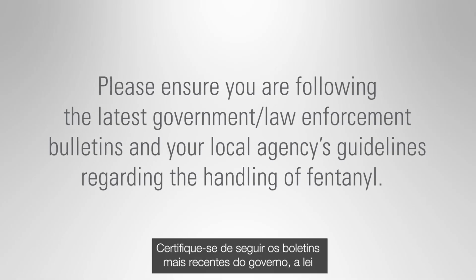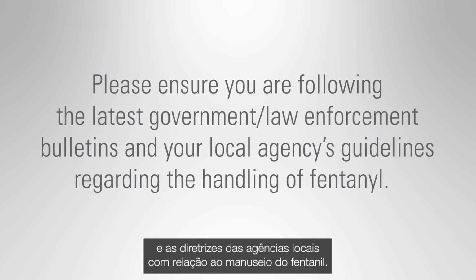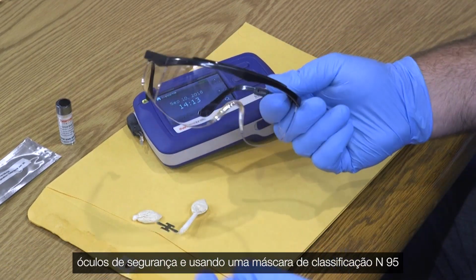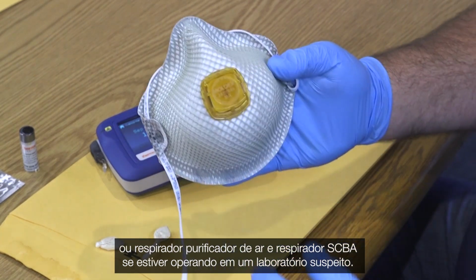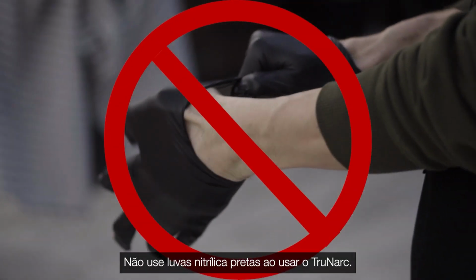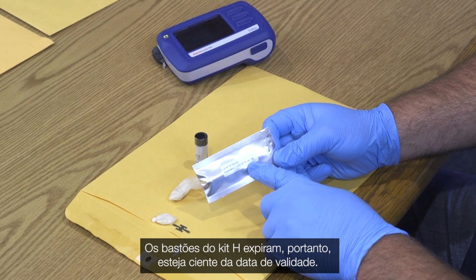Please ensure you are following the latest government and law enforcement bulletins and your local agency's guidelines regarding the handling of fentanyl. You should be protecting yourself by wearing nitrile gloves, safety glasses or goggles, and using an N95 rated mask or air purifying respirator, and an SCBA respirator if operating in a suspected lab. Do not use black nitrile gloves when using the Trunarc. H-kit sticks do expire, so be cognizant of the expiration date.